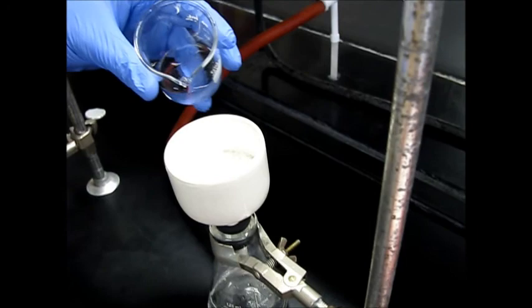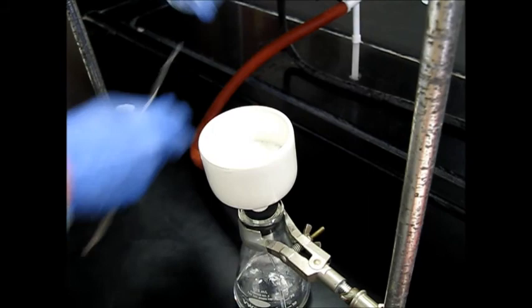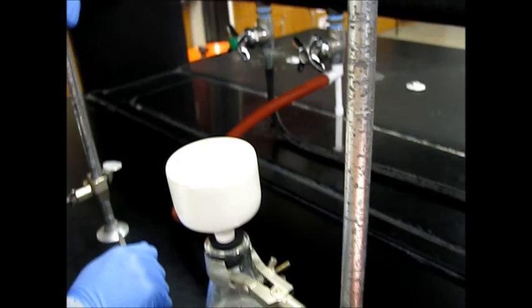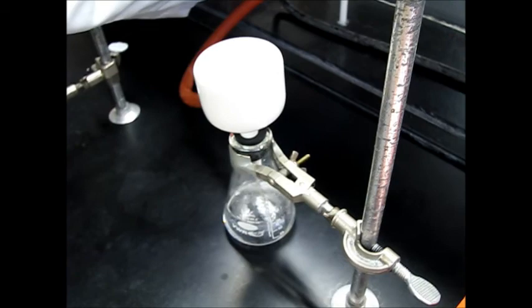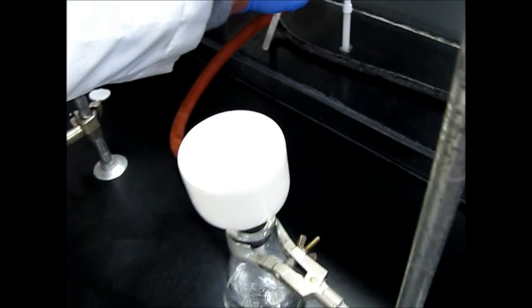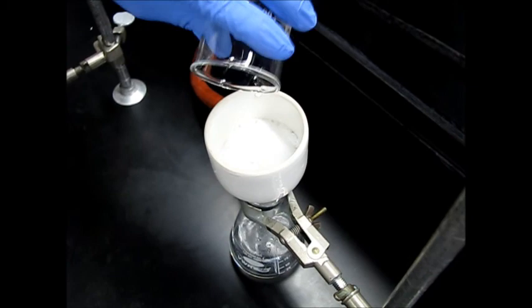So add water and hold and then filter. Add, hold, and filter, right? Yeah. Let it sit for a minute. This just kind of helps get out anything if there's any trapped phosphoric acid. Having these washes like this kind of really helps get everything out. This will be our last little wash.